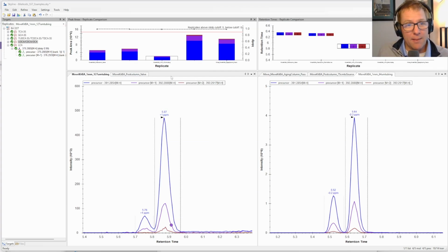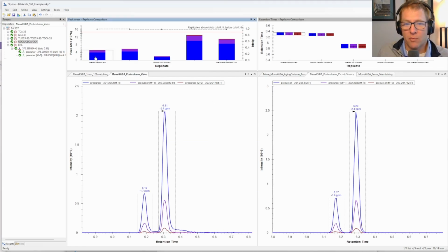So another example, which came from a collaborator of ours, who asked us not to share who it is, but you know who you are, and we really appreciate you allowing us to share this, is the importance of post-column connections. In this case, this is a 2.1 millimeter separation of these two bile acids. This is the CDCA-DCA critical pair. Both of these use a 75 centimeter piece of red 0.005 tubing post-column.